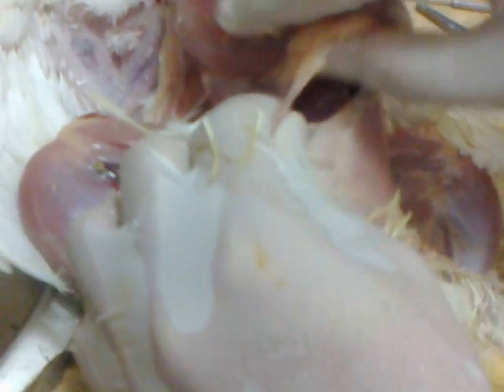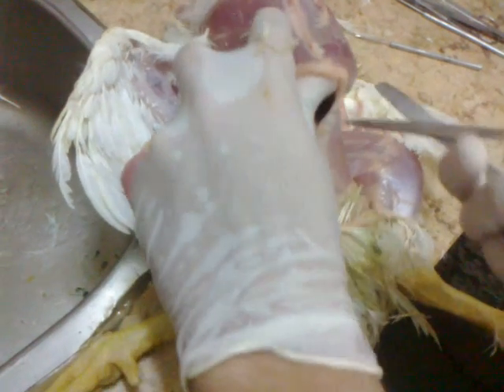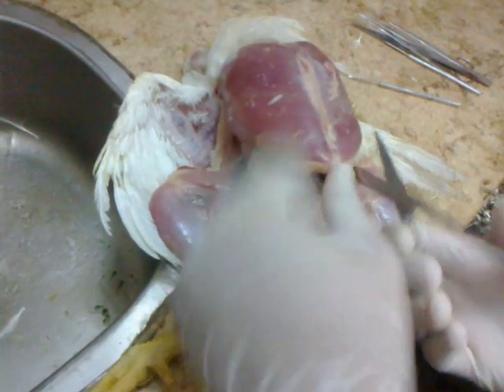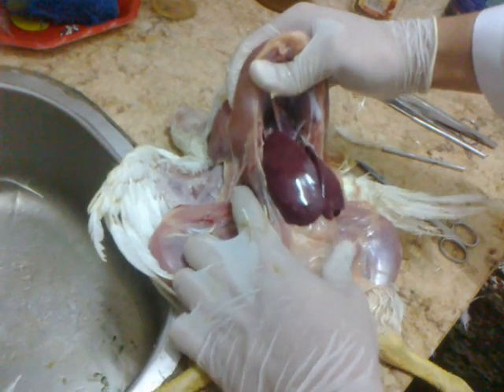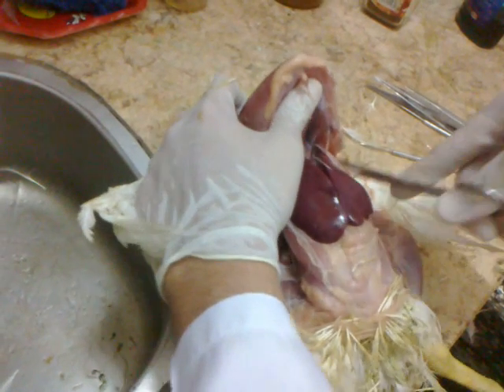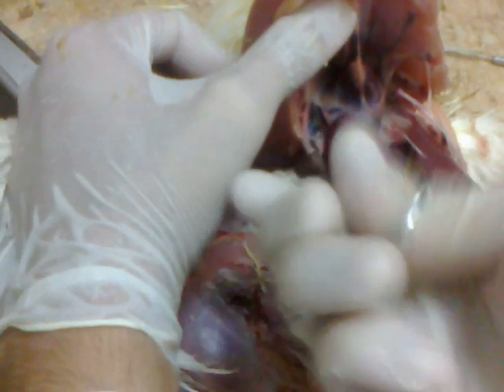As I mentioned, using sharp scissors will help you a lot. Use the blunt side of the scissors from the inside like this, so as not to hurt the internal organs. Be very sensitive with your hands because you need to see the air sacs. This is the thoracic cage that we are cutting into now.